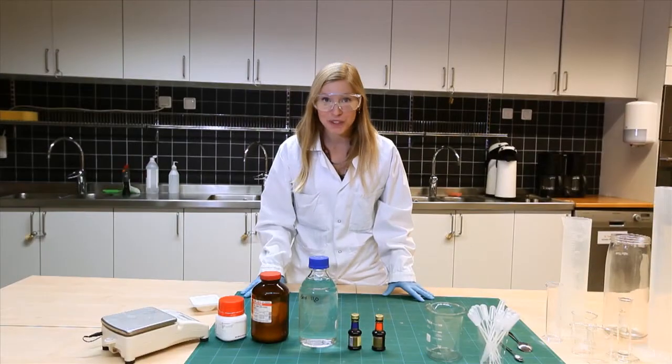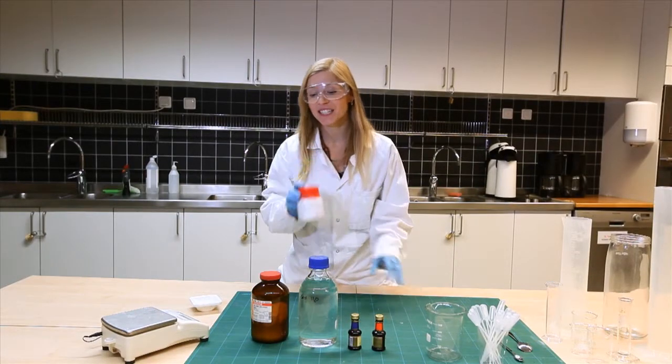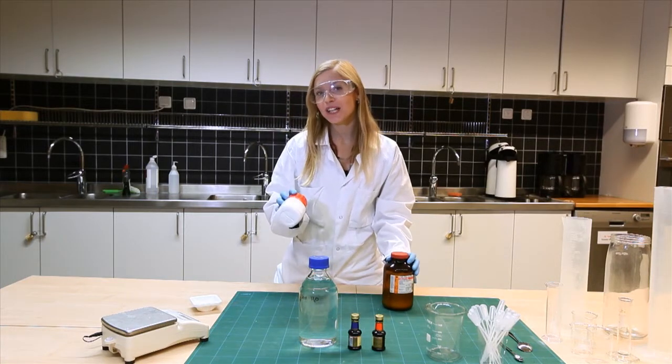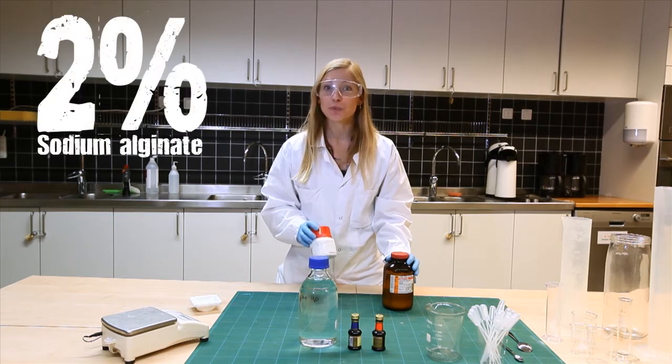First we're going to make two different solutions, one with sodium alginate and one with calcium chloride. For the sodium alginate solution, we want the final concentration to be 2%.